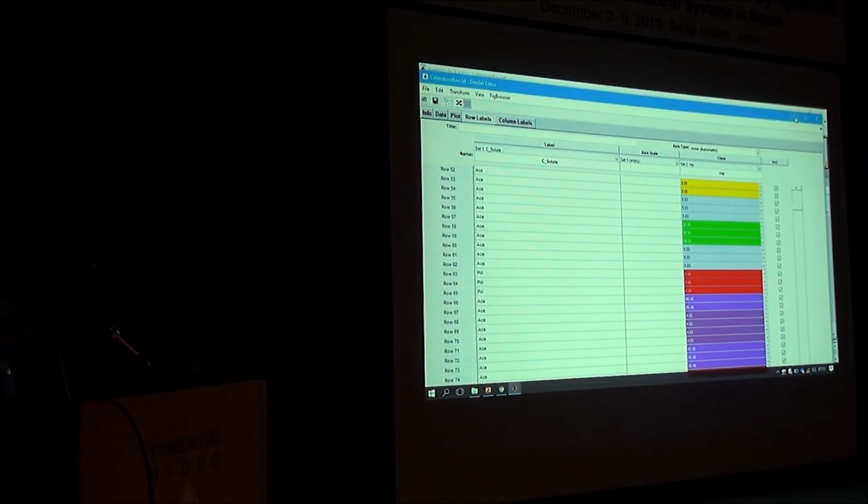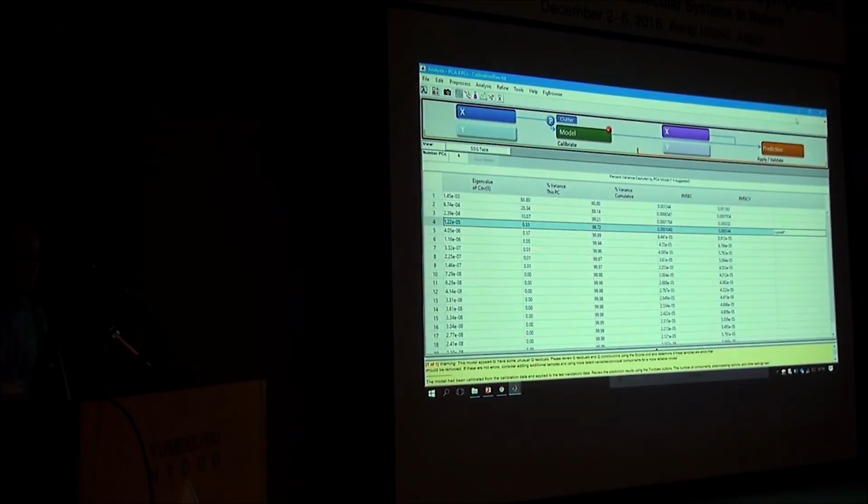As I will explain tomorrow, each group of these samples will be mean-centered according to that group. So we do a cluster centering, rather than mean-centering on the whole data. We said the difference between the means of different groups is not something we want to get rid of. That is the information. The difference between the samples after correcting for the mean of each group, after class centering, that is the perturbation. That is what we want to get rid of. So after mean centering each group, we cluster them together and do principal component analysis on this one and remove those factors because those are perturbation. I have some slides tomorrow that hopefully will show that clearly. It's a very useful software to work with.